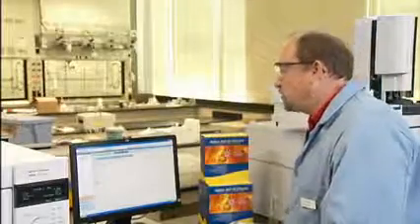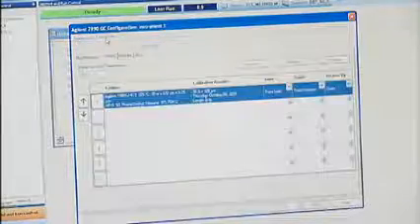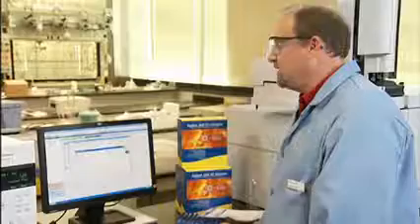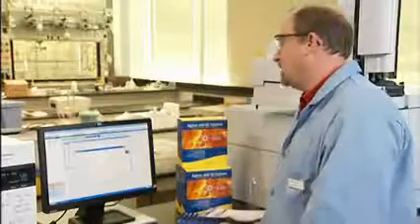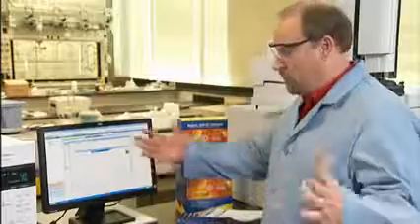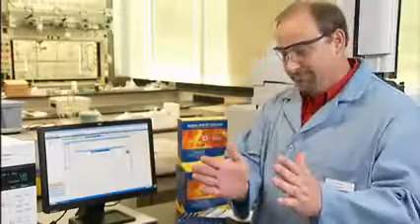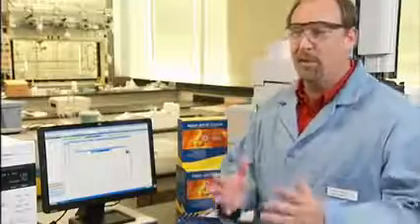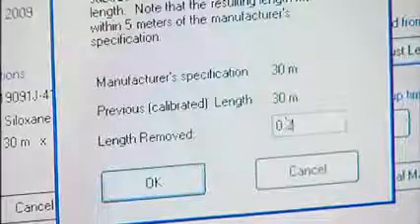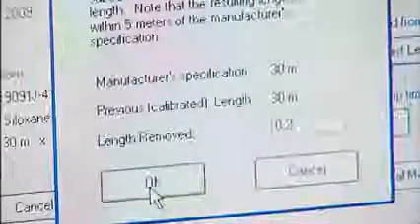We just go into Instrument Configuration. We go ahead and click on the Configuration tab. It's already on the column section. And then we go to click on Calibrate. And now we have Set Length or Adjust Length. I like to use the Adjust Length because I just trimmed the column. I go ahead and go in there and I figure out how much did I cut off, and I know that this is a meter and that's a half a meter, and I probably cut off 2/10 of a meter, and that's good enough. It'll give us a good estimation. So I put in 0.2, I hit OK, and my new length now is calculated on the column.